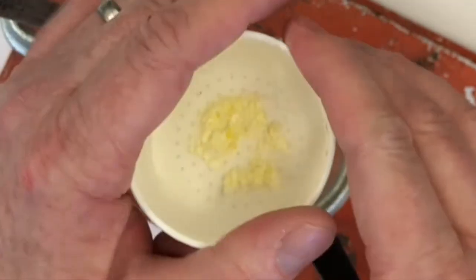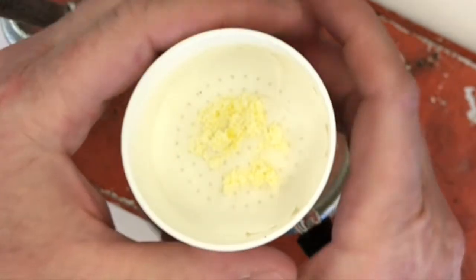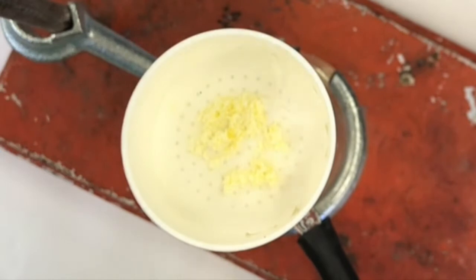so that looks pretty good. So now I'll let that sit under vacuum, the water aspirator vacuum, for about, I don't know, a minute, a couple minutes. I don't like to waste too much tap water. And then after I let it sit there for a little bit, I'll take this out and let it air dry, and then I'll characterize a little bit. Maybe we'll do an IR, and what the heck, maybe we'll do an NMR as well.